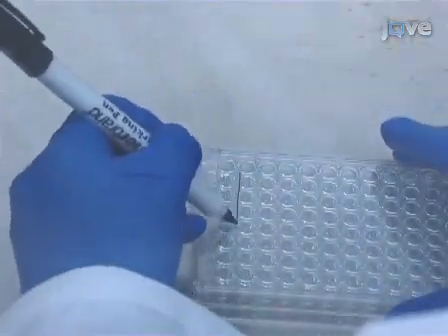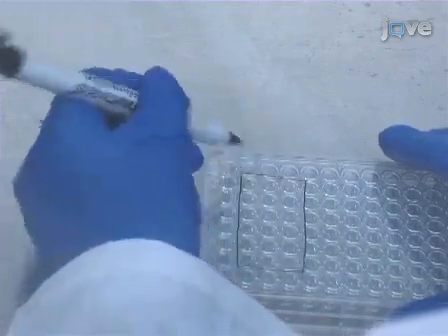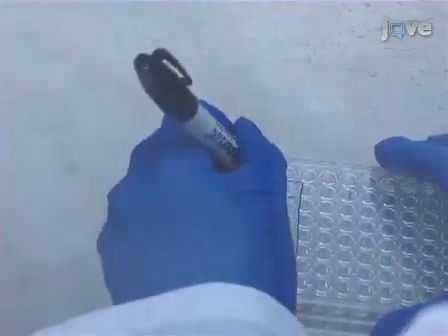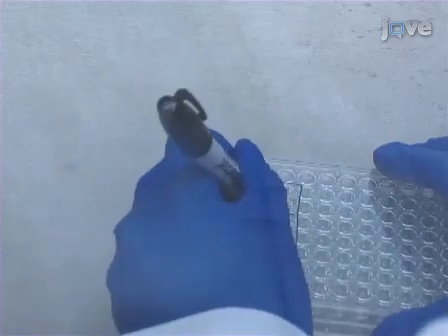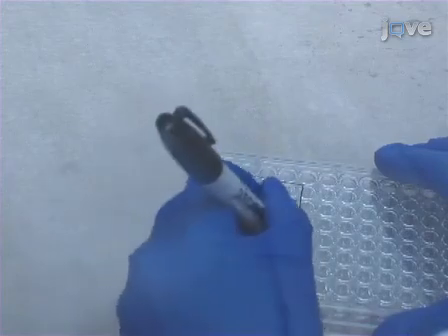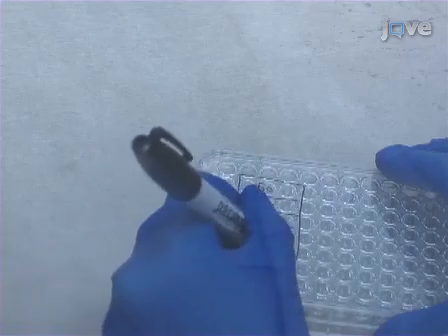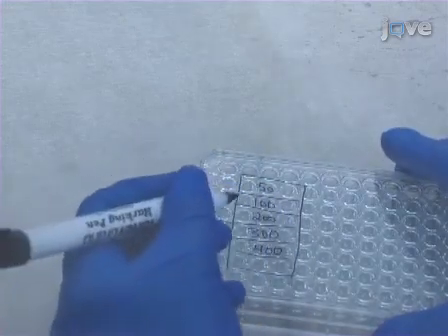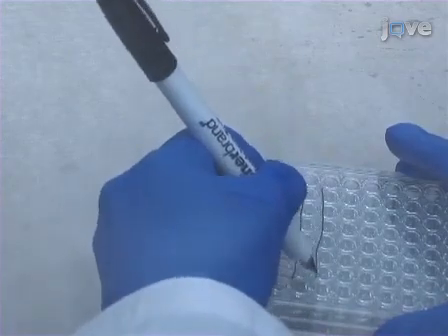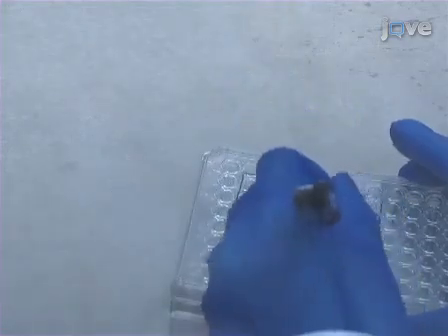Next, determine the number of 96-well cell cultures needed to accurately determine polymer-complexed toxicity using the MTT assay. At least 6 concentrations of chondroitin sulfate and polybrene should be tested in triplicate. In addition, untransduced cells and cells grown in serum-free medium should be included to provide a baseline for healthy cells and to control for growth arrest, respectively.